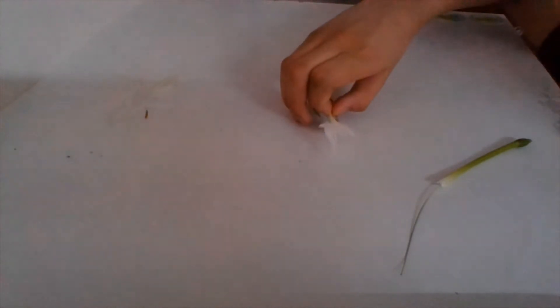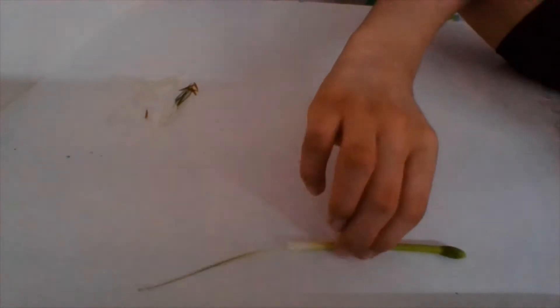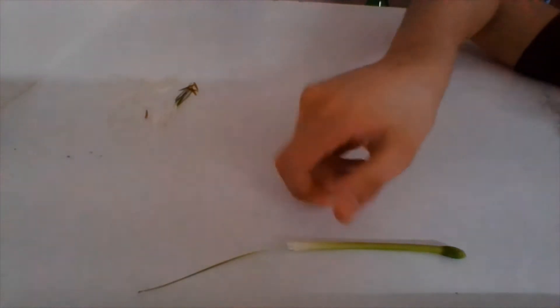Now we will take the male parts away and focus on the female parts. The female parts are comparatively very complex. The female parts in a flower are basically divided into three parts: one, the stigma; two, the style; and three, the ovary. We will first focus on the stigma — as you can see the stigma is a little broader at the top.